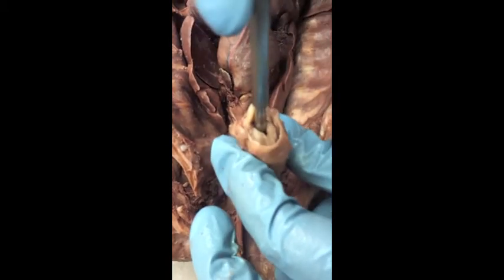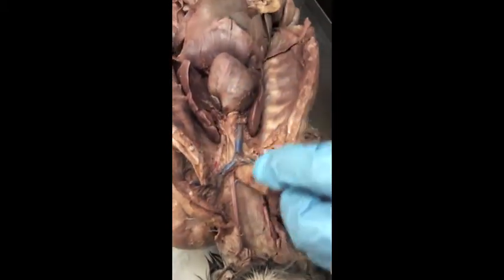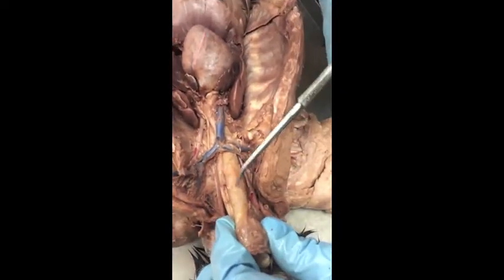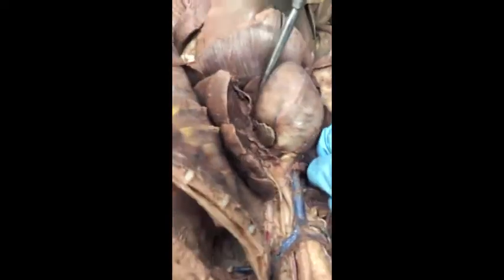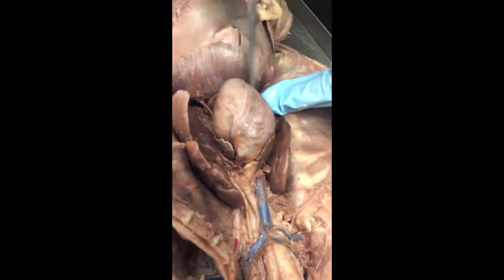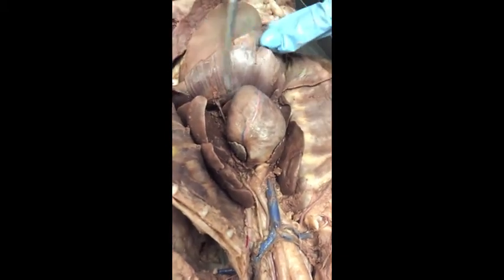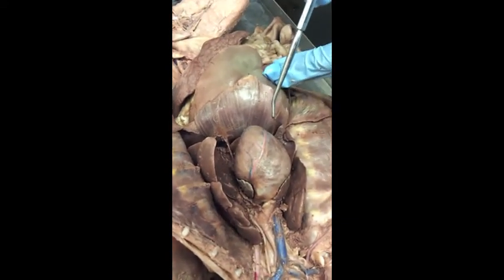Right, so we can go down the airway this way, or if we continue down the back side, the esophagus runs right behind, right posterior to the trachea. So the trachea is going to come down. We're not going to see the split on here because we'd have to remove the heart, but the lungs, they have a lot more lung lobes than we have, but this is all lung up in here. And then this big dome-shaped muscle sitting right below the heart and lungs is going to be the diaphragm.